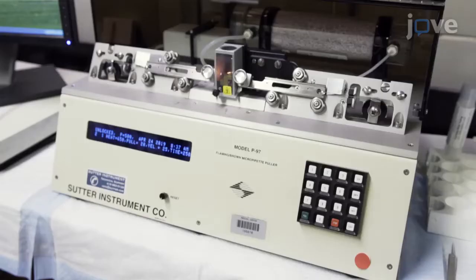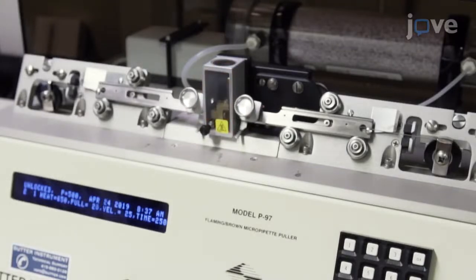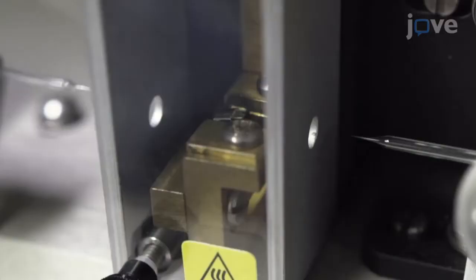To prepare the borosilicate glass microelectrodes, use a standard puller to achieve a short, gradual 8-10 mm taper with a less than 1 micrometer diameter, looping twice for higher resistances and smaller tips.